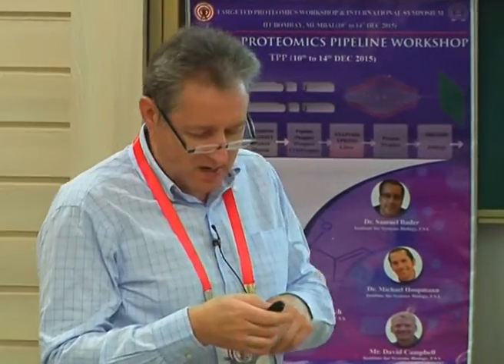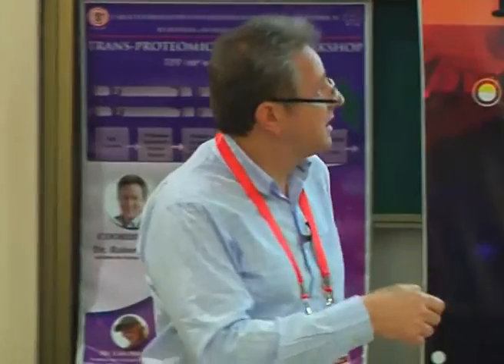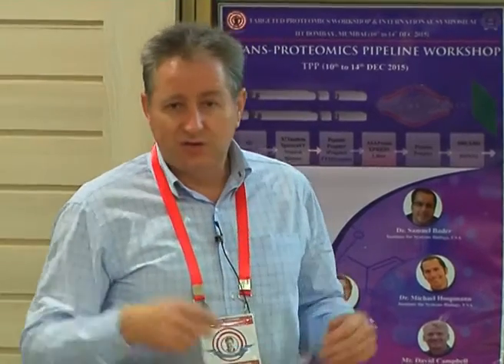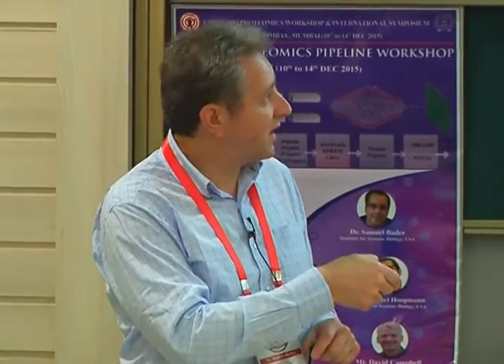So today, what we're going to be looking at is the cross-link analysis with Kojak. You'll also go through the resources that we have for SWATHAtlas and SRM-Atlas. And then we're going to finish it off in the afternoon to take you through a data analysis process using SWATH data. And this will be done by Sam, but you won't have the software there.